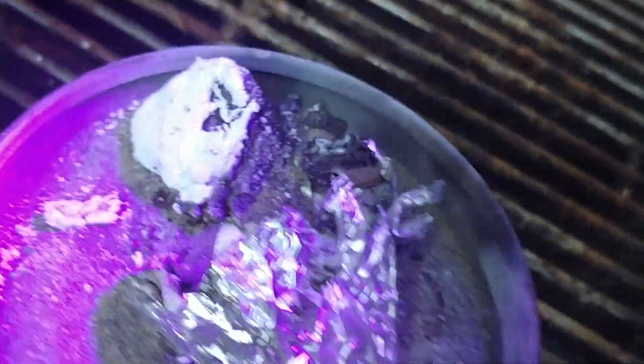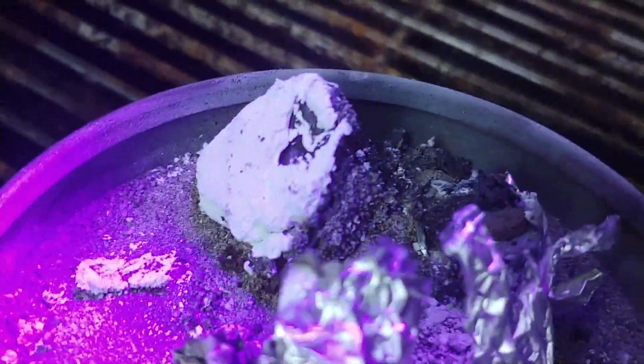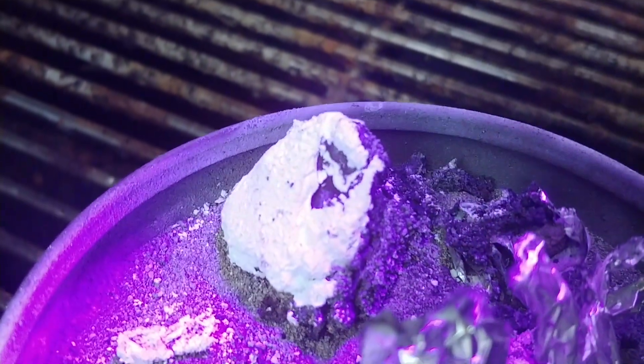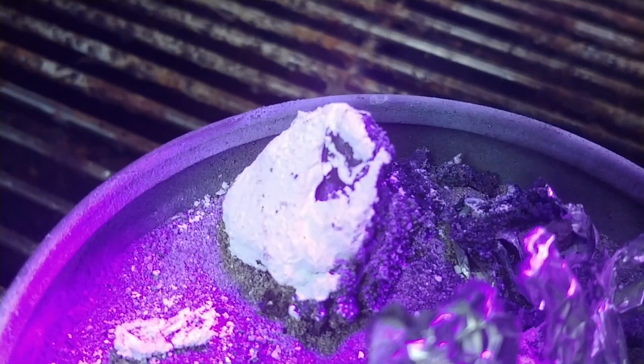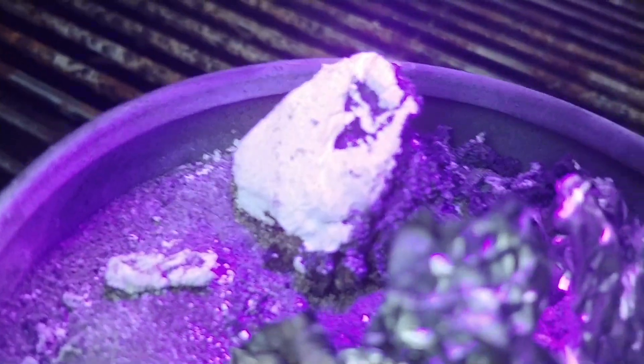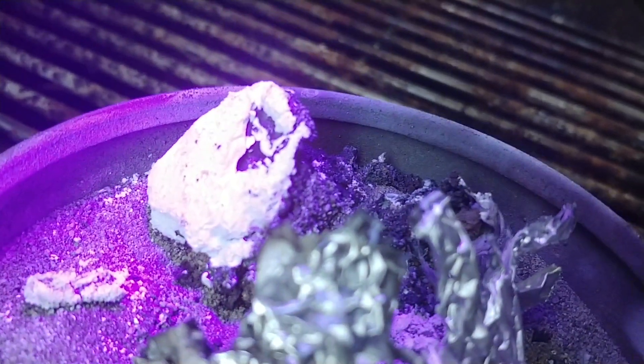So now what we're gonna do is shine the UV light on it. You know, yeah, it brightens up a bit, but I don't see any pink or bright red spots. Nothing in there either. I was really hoping that there might be an interesting way to get some of the oxide mix to fuse together and make incredibly crude red corundum, which would be basically ruby — I don't know, really crappy ruby, but still. I can actually see a tiny bit of pink there, so maybe once I scrape away some of that unreacted oxide I might be able to find something.